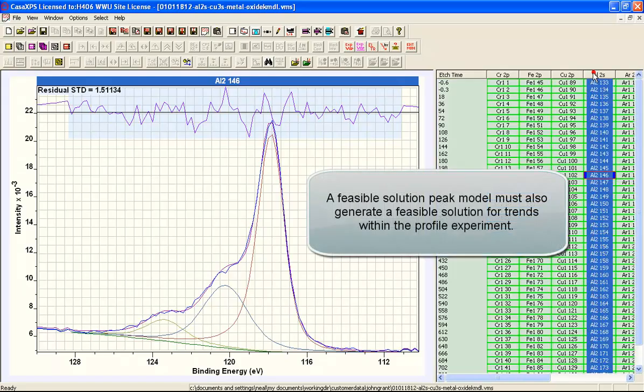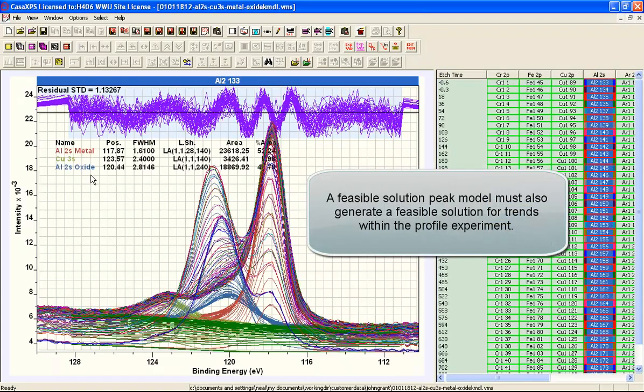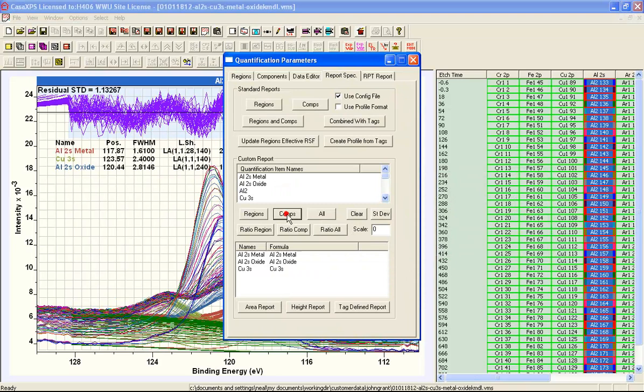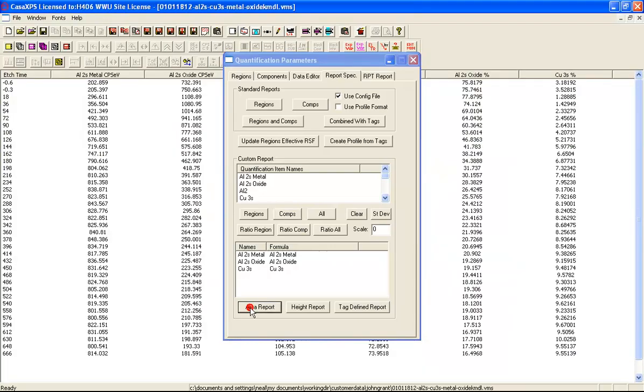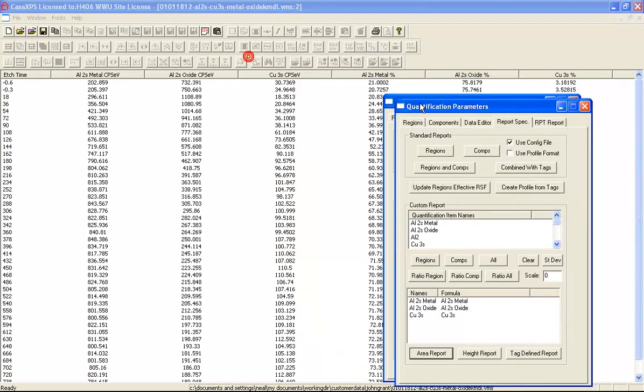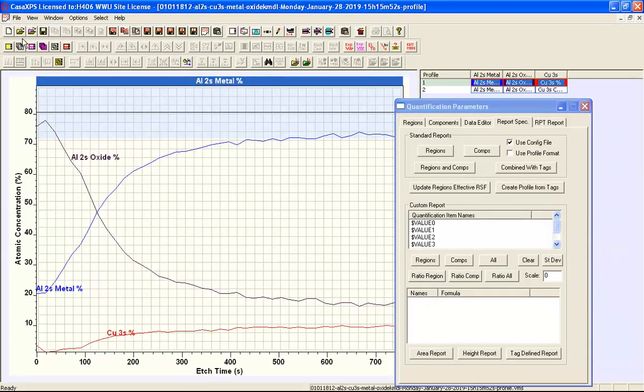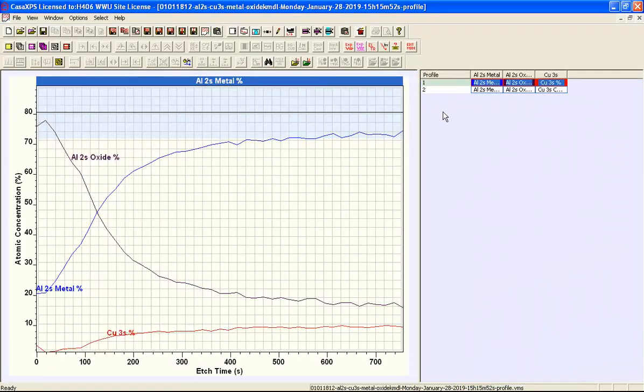Finally, to assess this profile that we've organized in terms of these three peaks, we could use the custom report, select components. So I've copied through from these selected VAMAS blocks the components that are defined on these VAMAS blocks. These are only the metal oxide for aluminium and the copper, and if I press apply, I then get a table of results, and if I say create profile, I end up with a profile showing how these peaks are behaving with respect to one another throughout the depth profile.